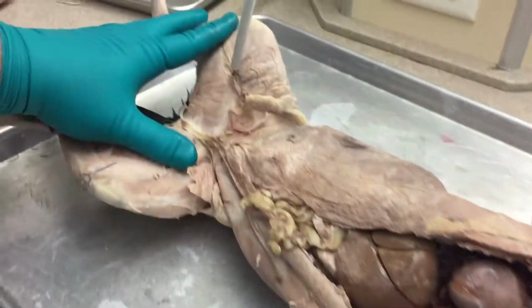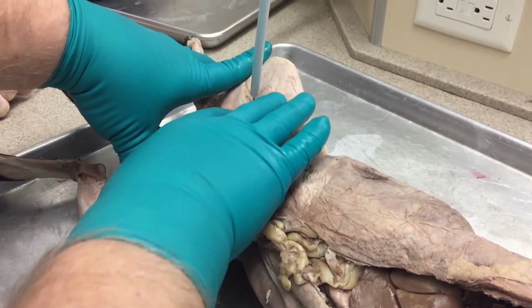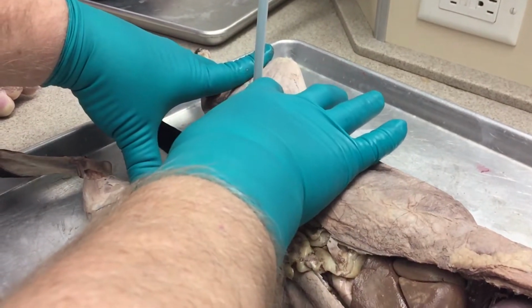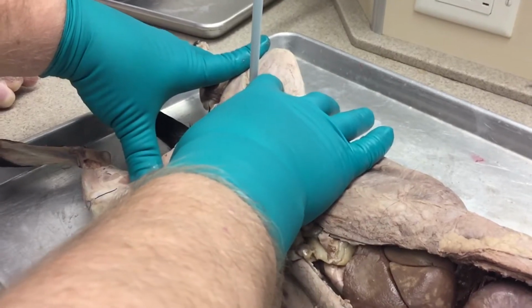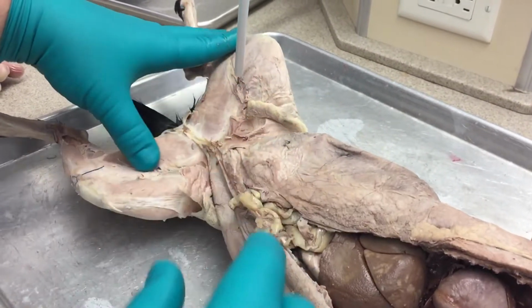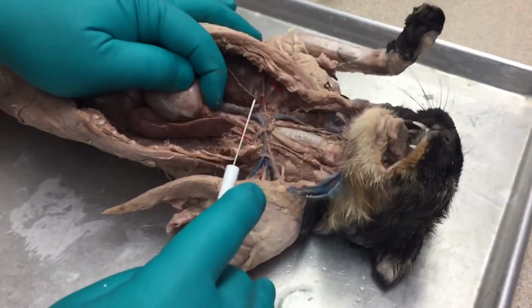If it was in the thigh over here, this would be the femoral. So this would be the right femoral vein is what you would have over here. So either left or right, and if it says red or blue, then the blue one will be the vein, the red one will be the artery. Okay, let's move on to the arteries then.